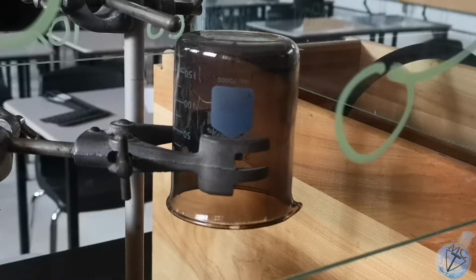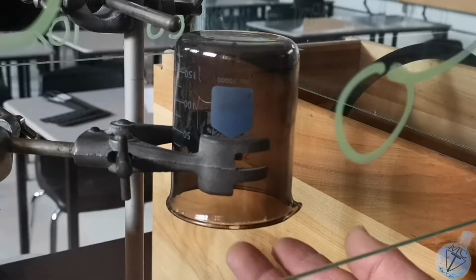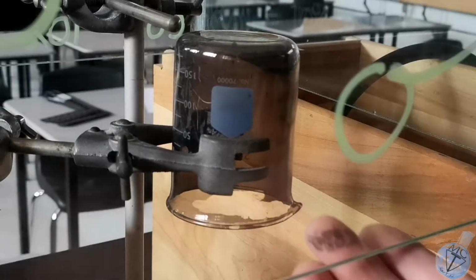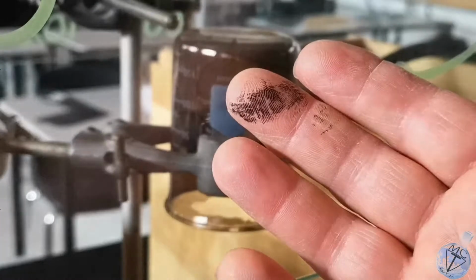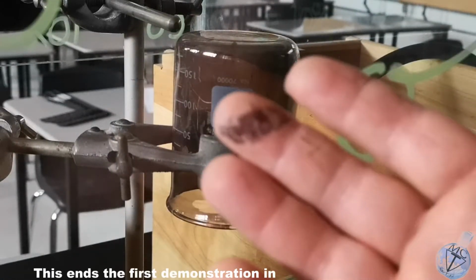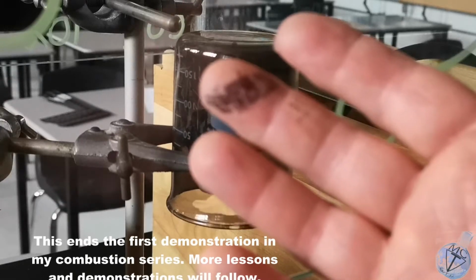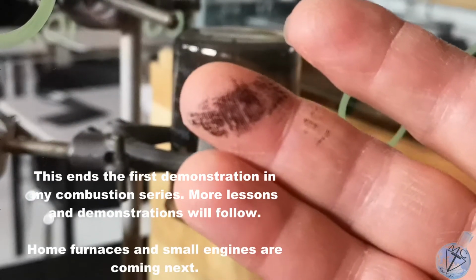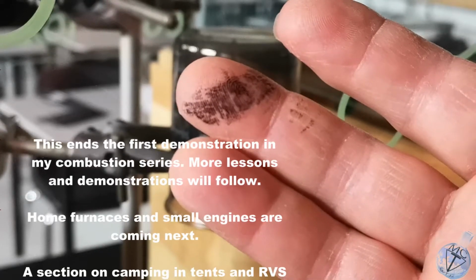You can see from this side what was once a clean beaker is now burned black with the product of incomplete combustion. Okay, that's the soot. Now this is all clumped together. The particulates are incredibly tiny. So this large scale soot is not of any concern really, it's just dirt.